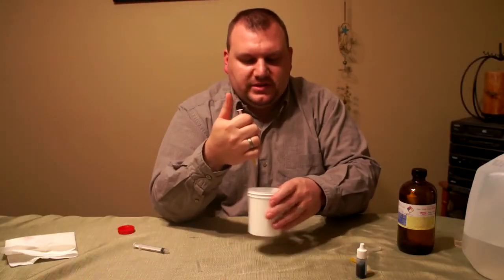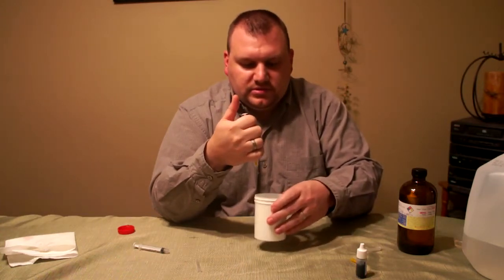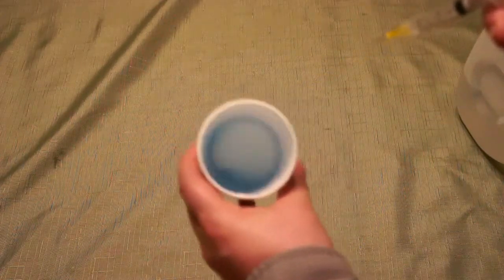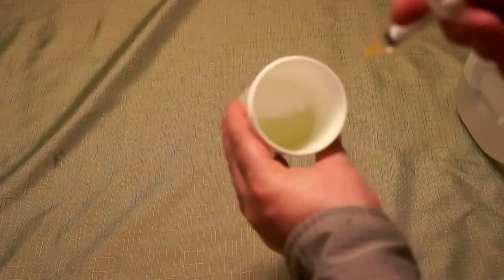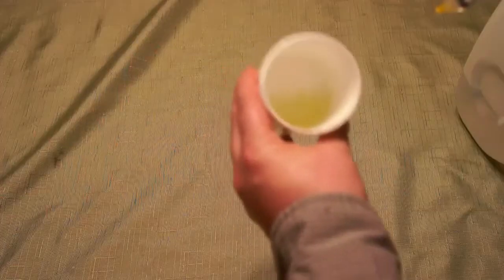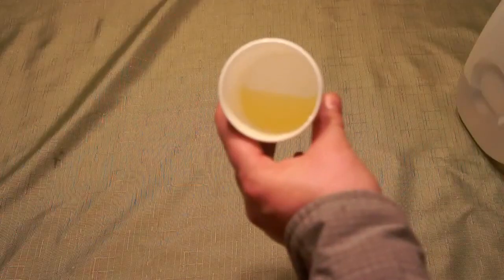I'm adding about 0.2 or 0.1 milliliters at a time. Now it's starting to turn color a little bit — now it's greenish. Now it's like a nice greenish yellow, so I'm going to start adding a little bit less each time. And just a little bit more — boom. Now I have a 100% yellow solution.